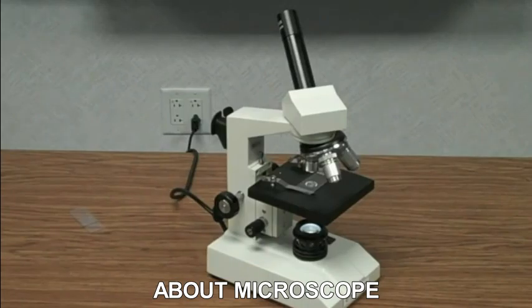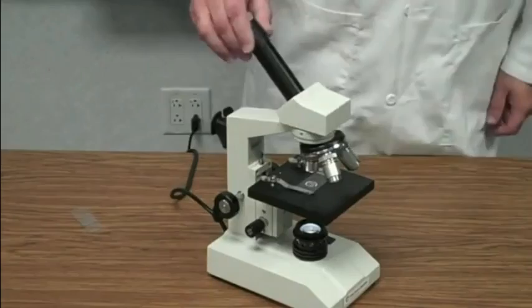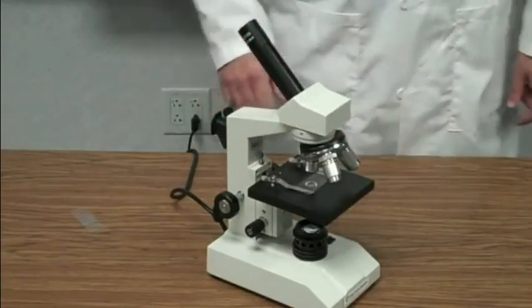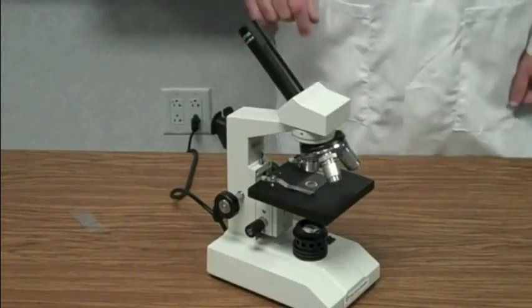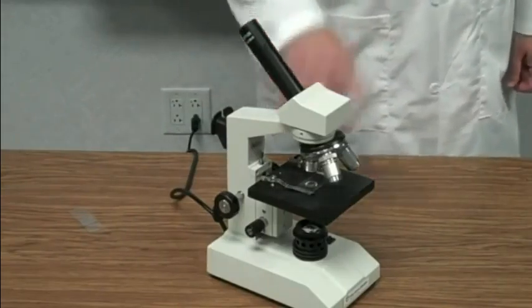What we're going to do first is talk about the parts of the microscope, and then we'll talk about how to use the microscope correctly. Okay. First thing, we'll start here at the top, and then we'll work our way on down to the bottom. First part of this is the eyepiece. This is where you look through to see the image that is being displayed on the stage.